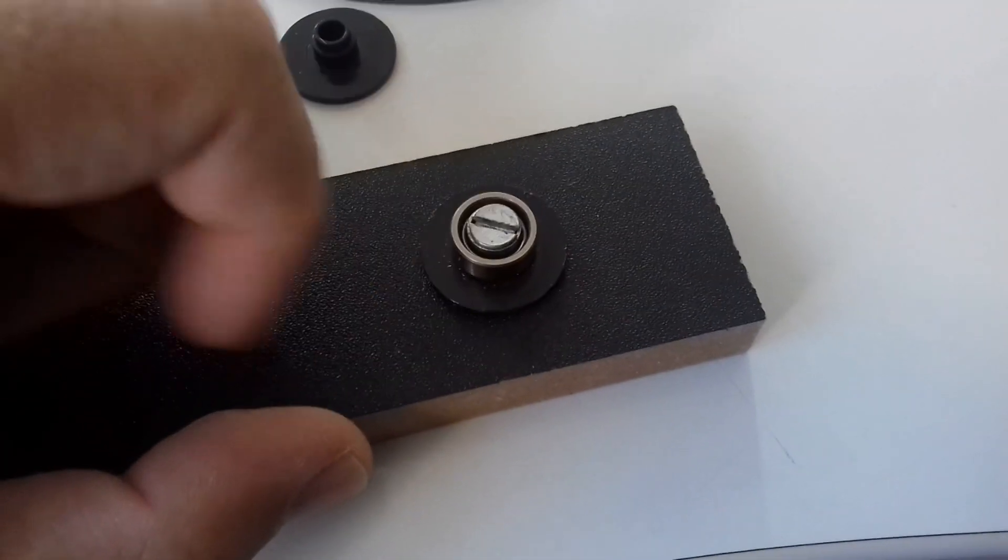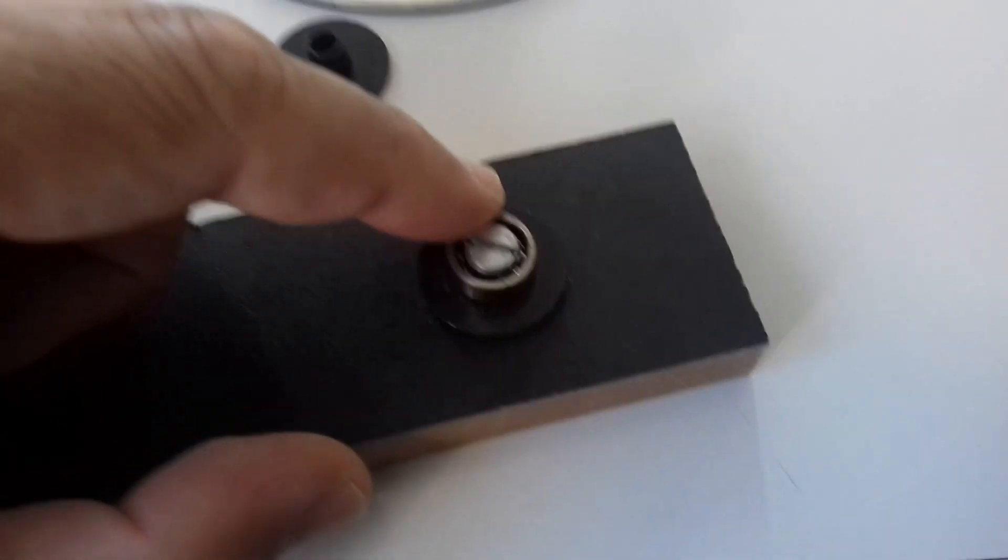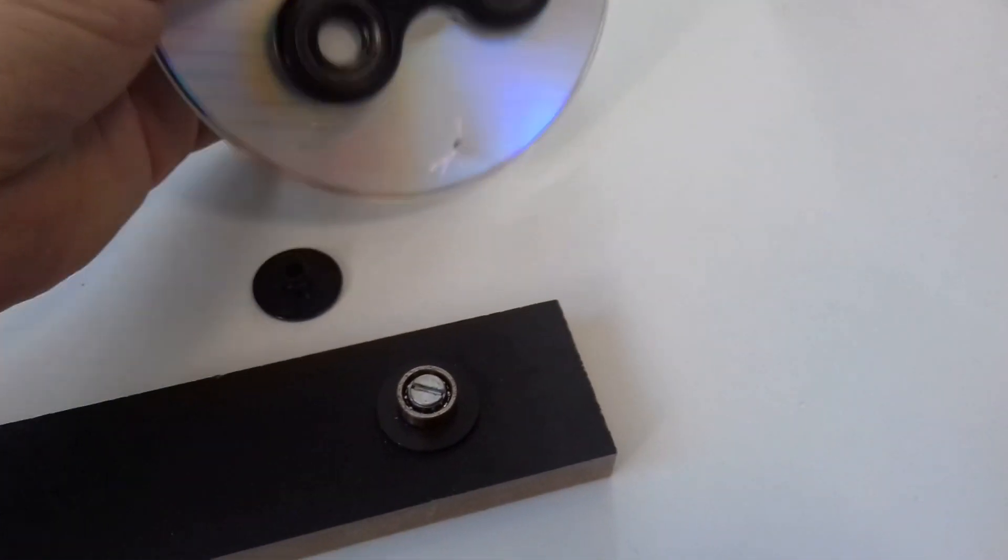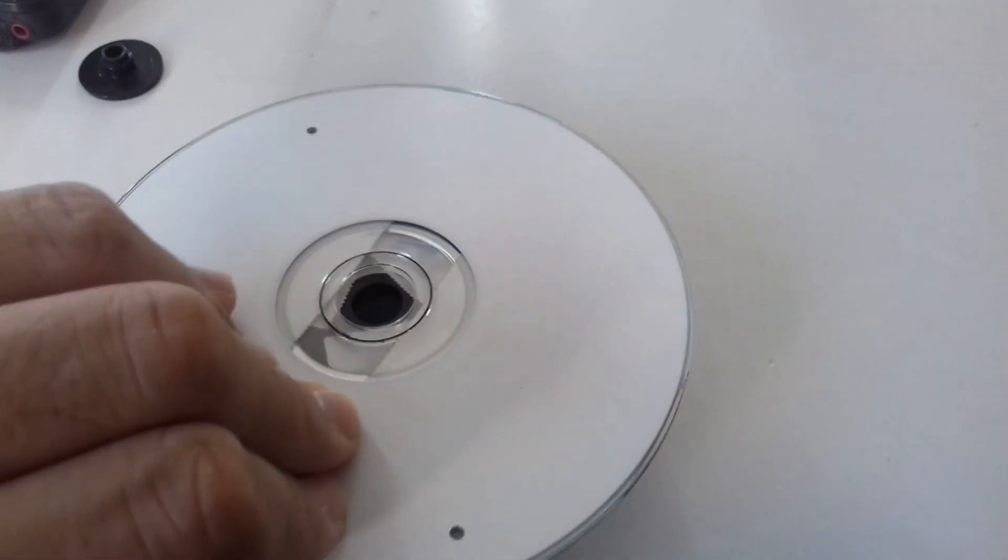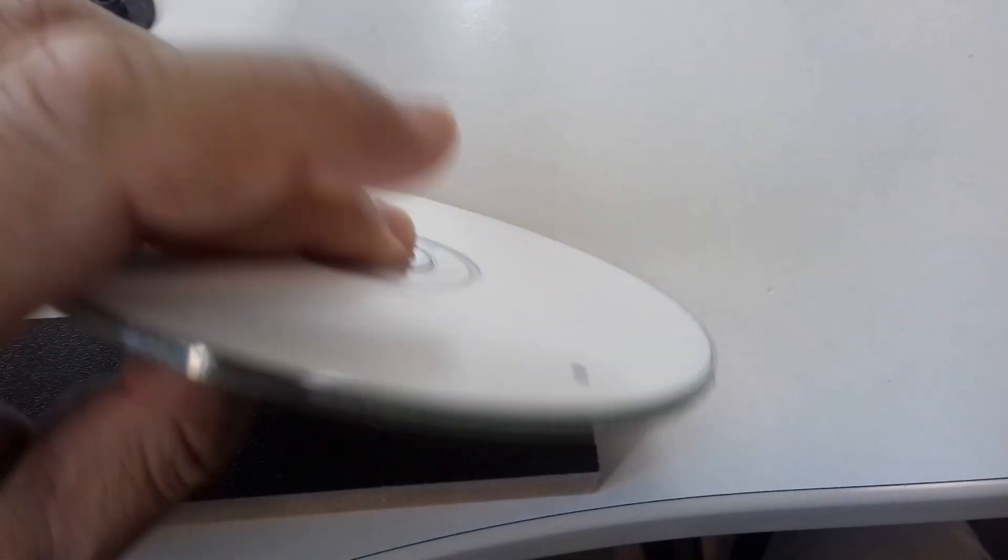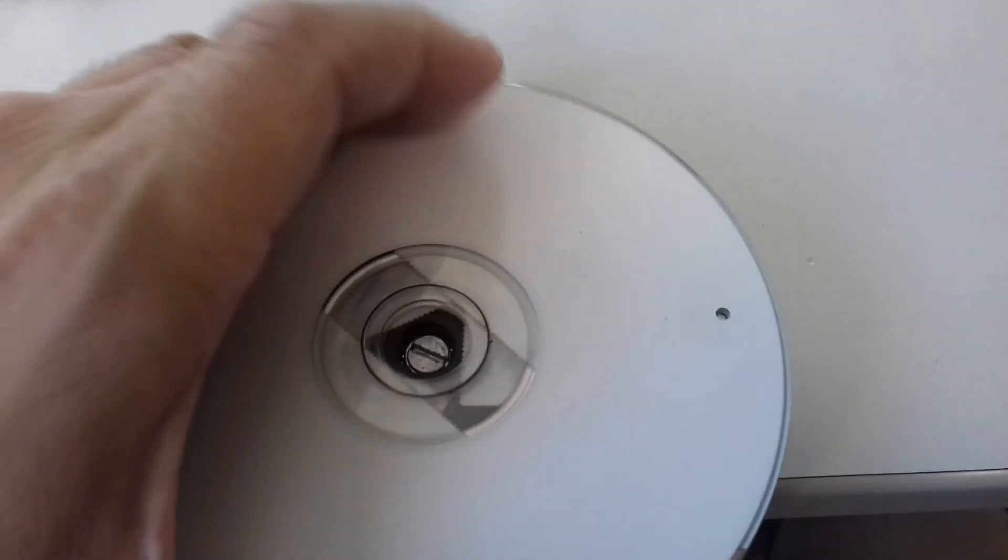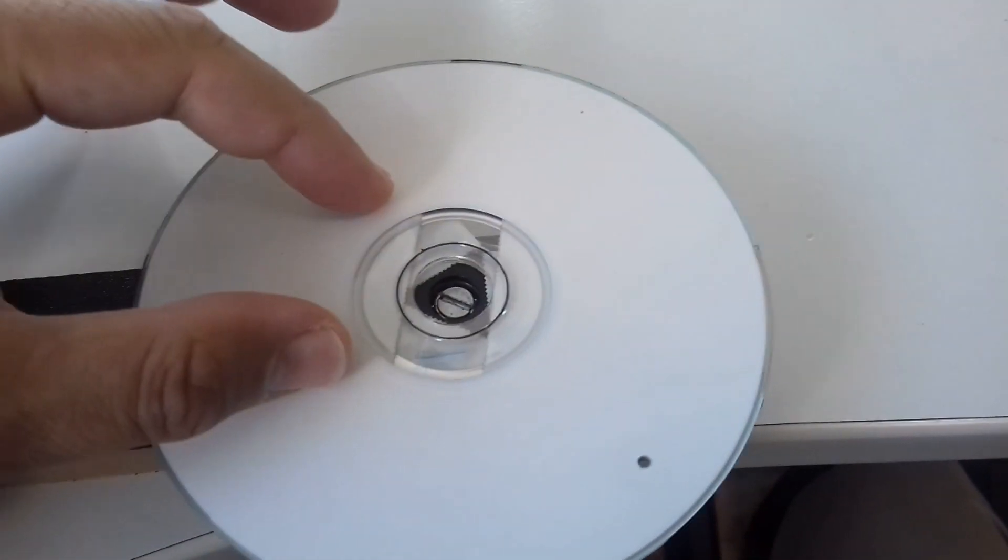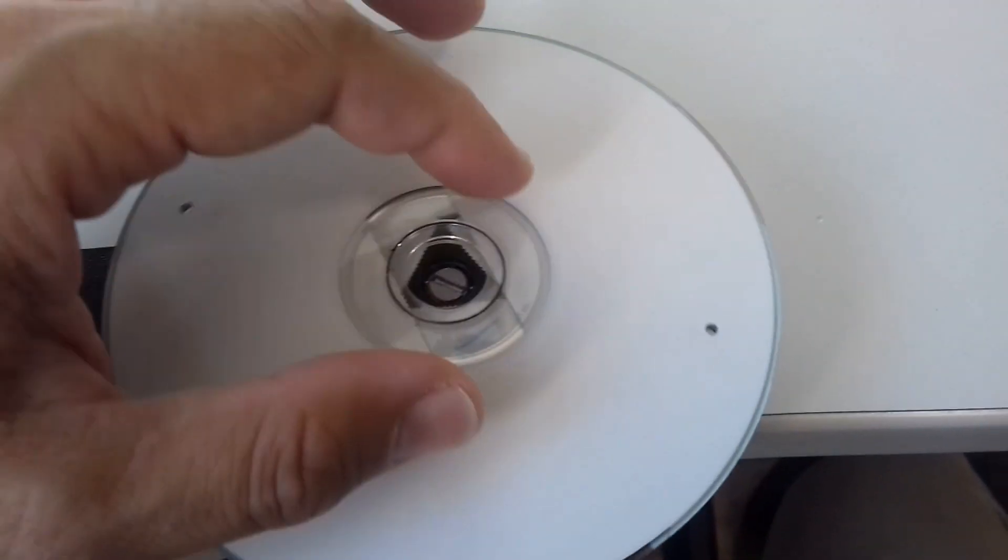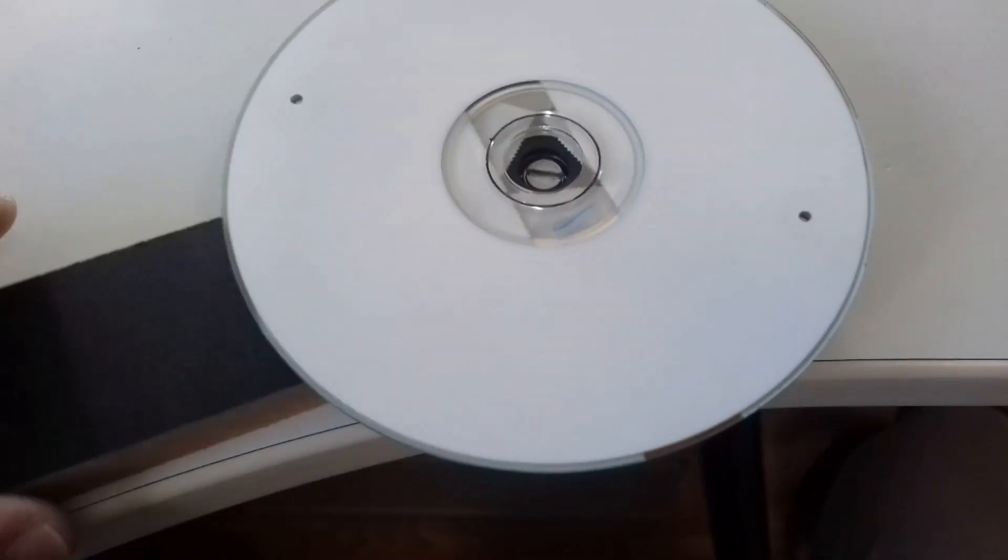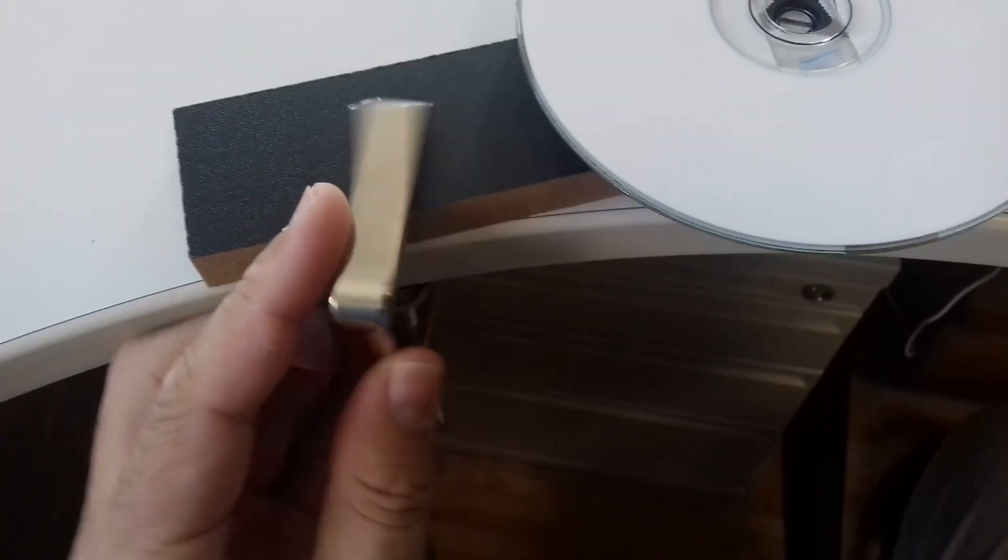The fidget spinner with the CD is simply held in place using friction. You can put a slide on top here. It's also possible to use sticky tape or scotch tape. This piece of wood I simply clamp to the table using a clamp.